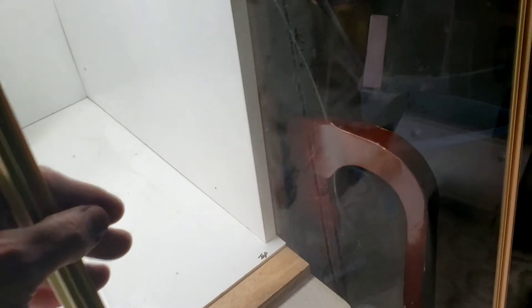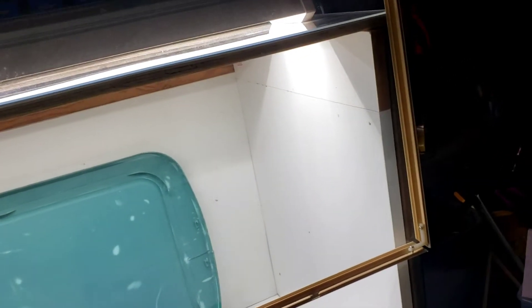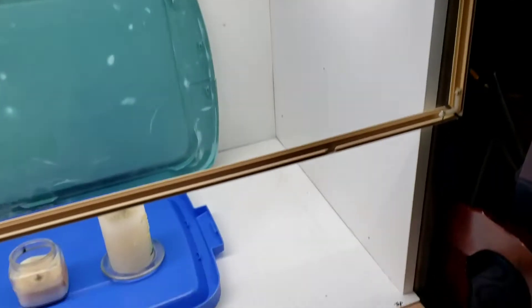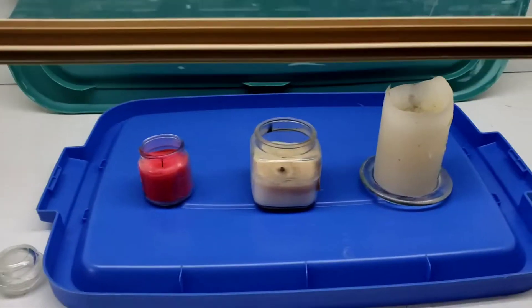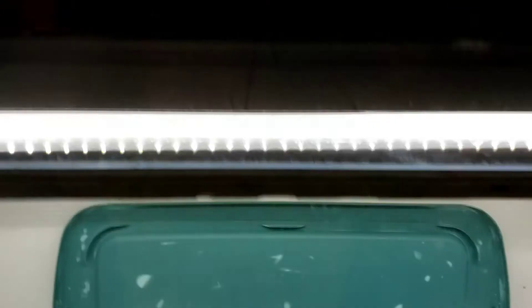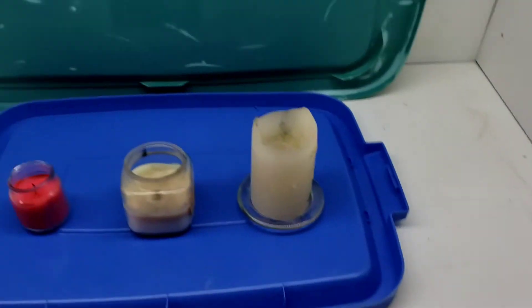I got this here - it'll be cut in half - something like this. And then of course there'll be a hinge along the bottom for a piece to close it all the way, and then we'll put something up the top to hold it up when we're working.